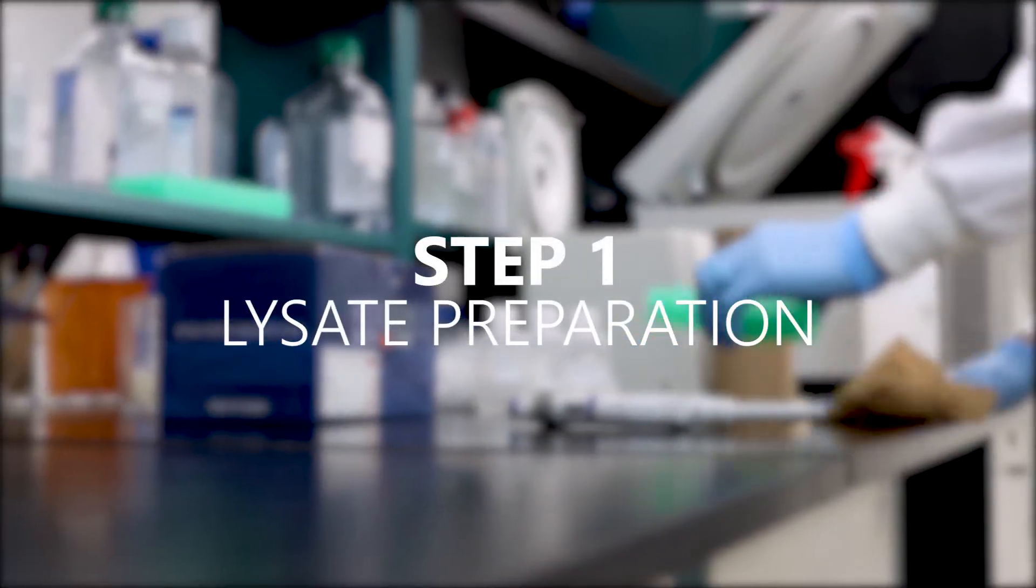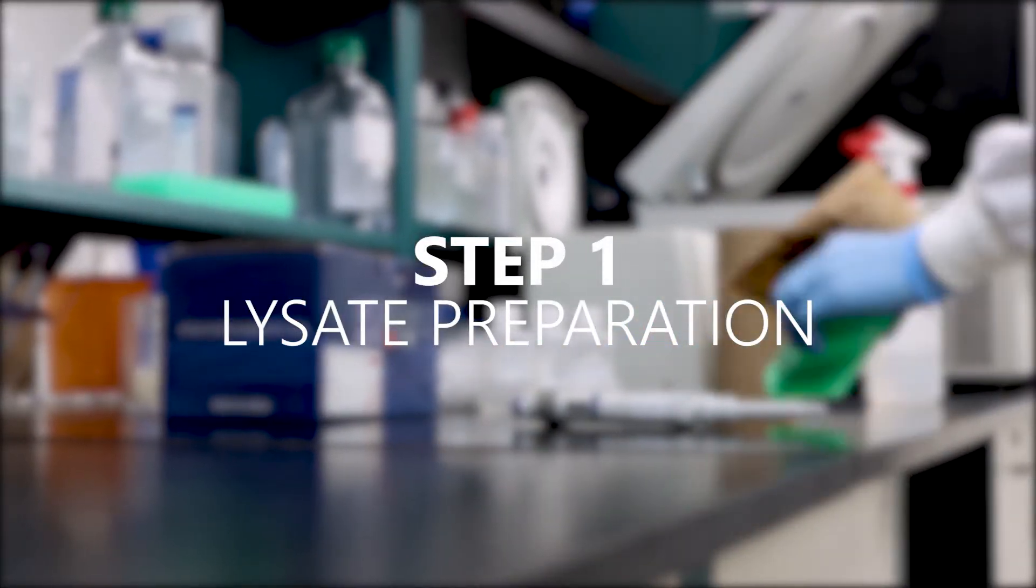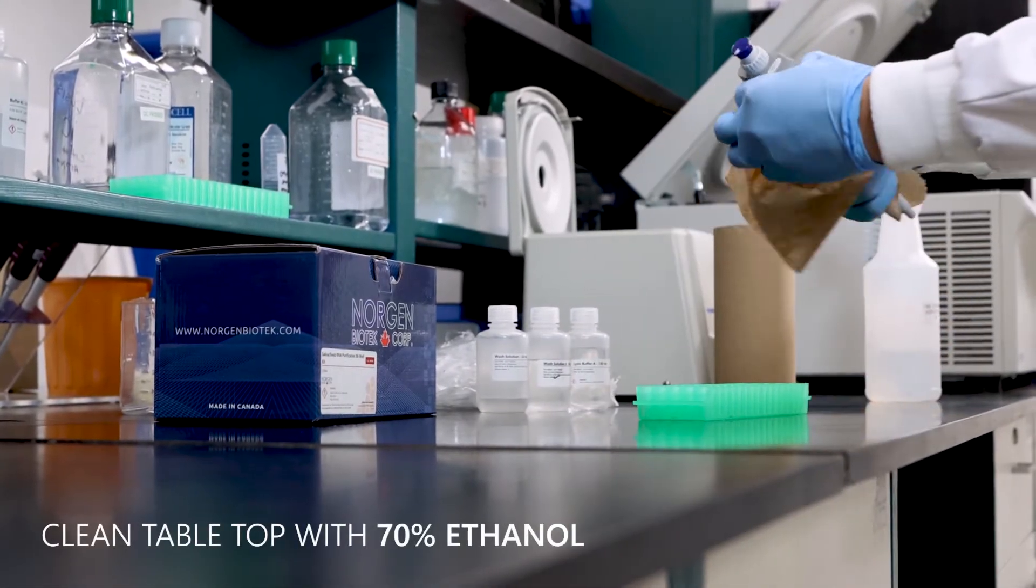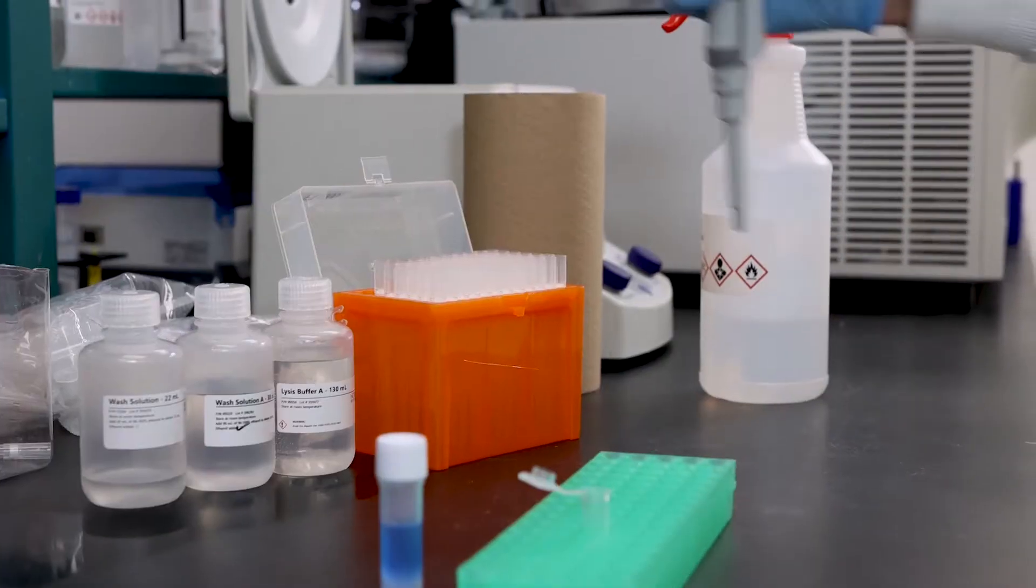Step 1. Lysate Preparation. Before you begin, it's a good idea to clear the workspace and clean it with 70% ethanol. This will minimize the possibility of contaminating your samples.